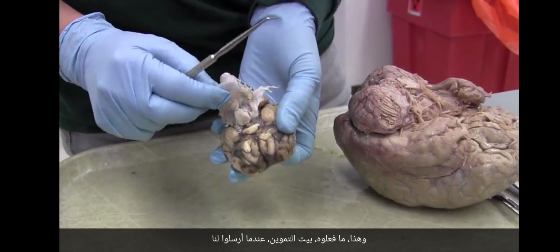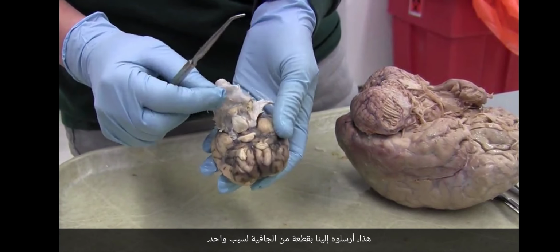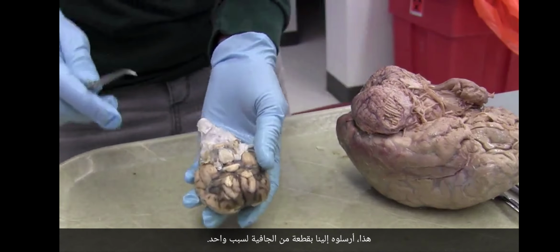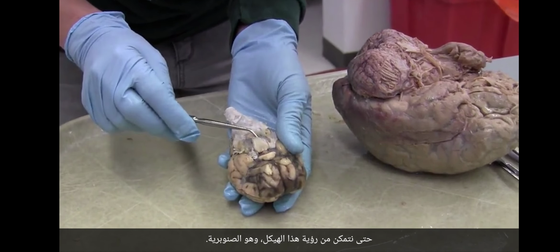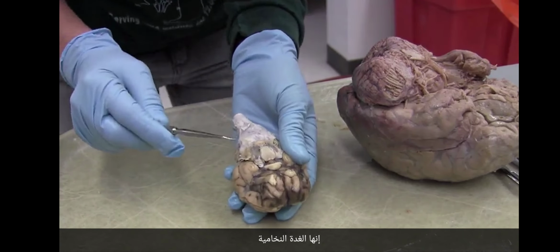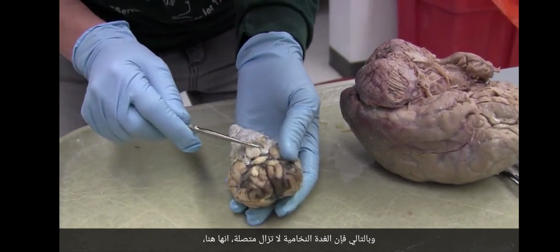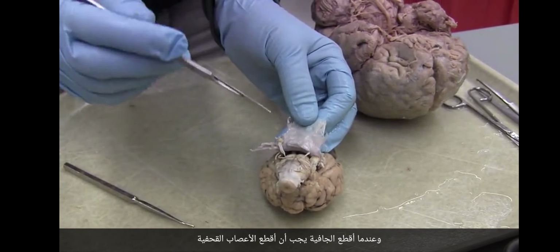And what they did, the supply house, when they sent us this, they sent it to us with a piece of dura for one reason, so that we could see this structure, which is the pineal. I'm sorry, it's the pituitary. This is the pituitary. So the pituitary is still connected. It's right here, and for that reason, we had to keep the dura on. But now I'm going to cut the dura off. And when I cut the dura off, I have to cut the cranial nerves.